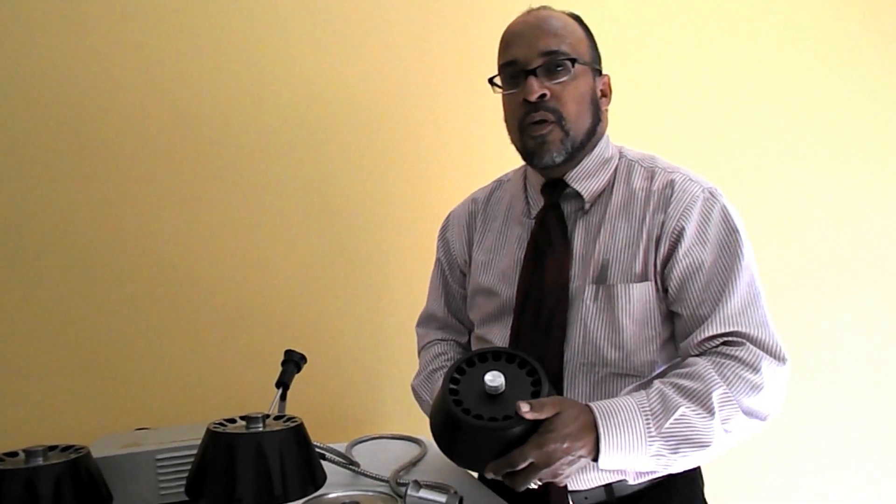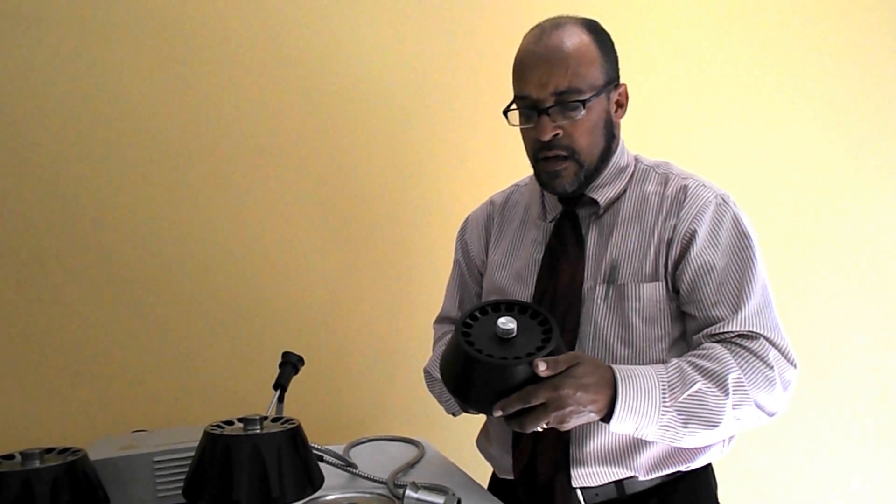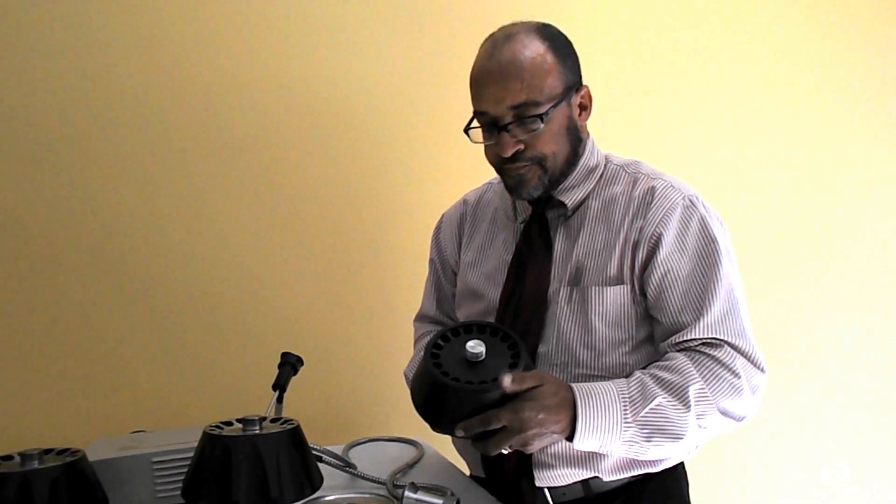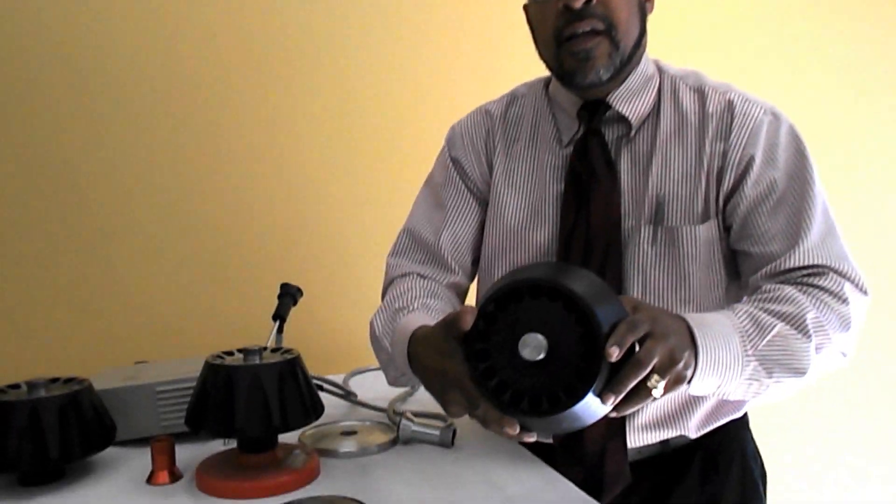This rotor can be cleaned with a cleaning solution called 555 solution or a mild detergent. Sometimes letting it soak will get the sediment out.